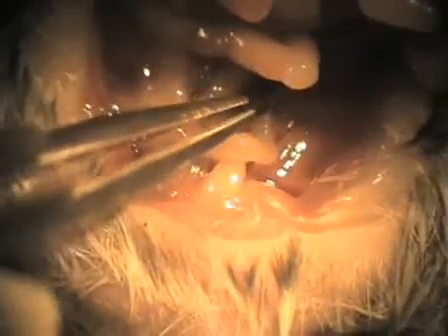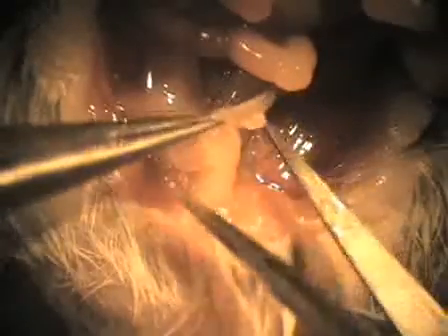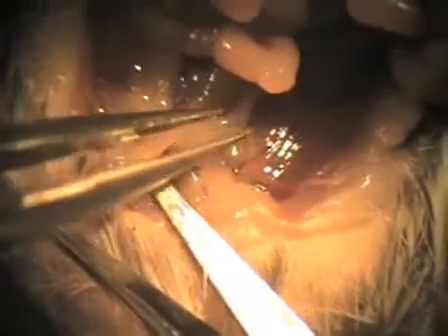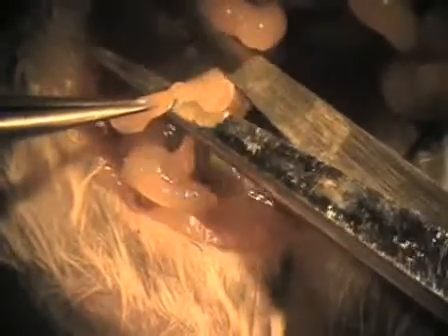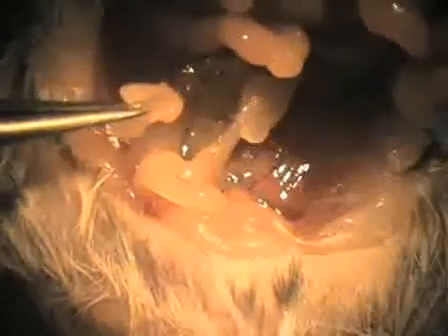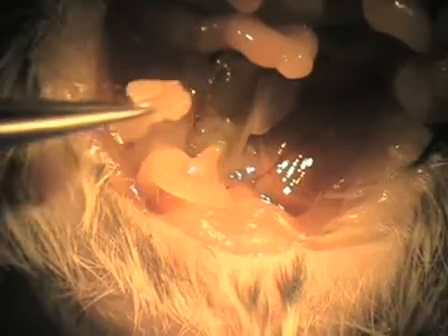Again, we're going to pick up the ovary, or the uterus. Pick up the uterus here, cut below our attachment point. The oviducts are found at this point. I'll be taking part of the ovary with us. This is then going to be placed in media.